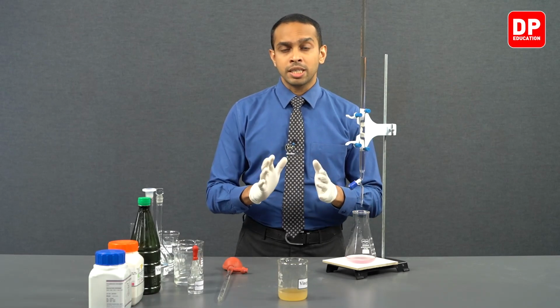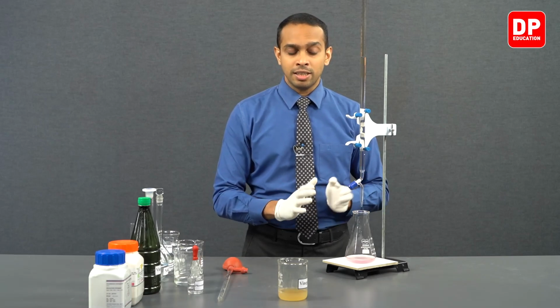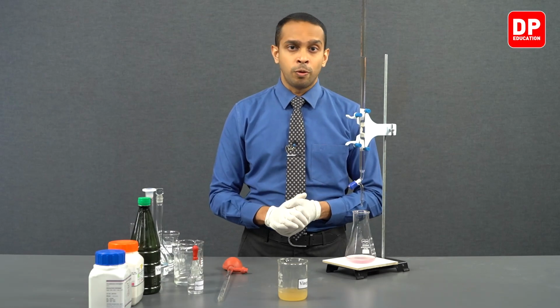So the very first titration reading was 21.4. Second titration gave us a reading of 21.3, and the third titration gave us a reading of 21.4, indicating all of these burette readings that we have obtained through these three titrations are concordant. So you can use all three of these burette readings for your calculations to figure out the concentration or the percentage of acetic acid in vinegar.